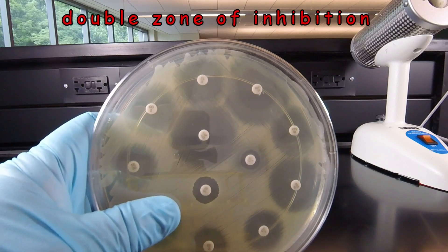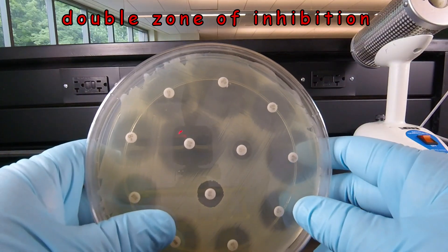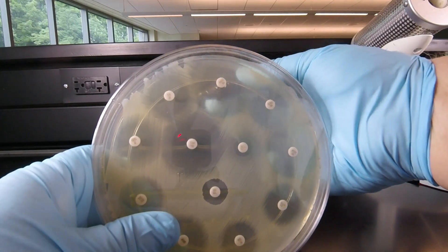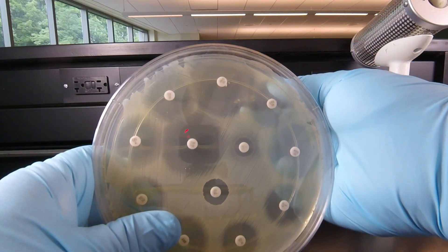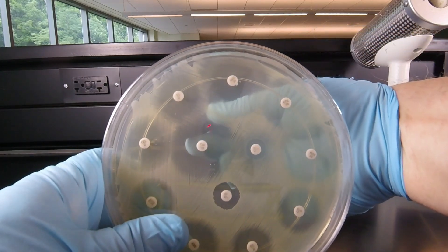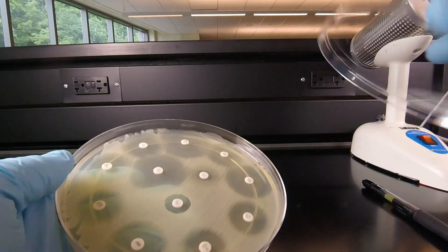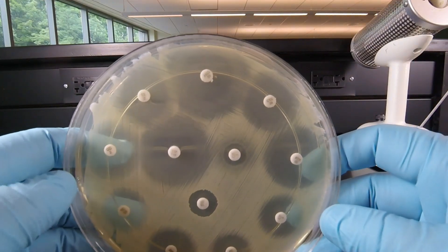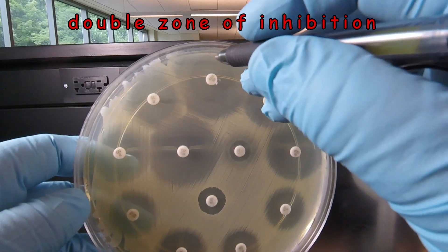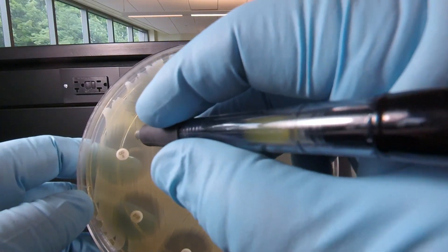Another thing you might see is a double zone of inhibition — where there's a completely clear zone surrounded by a hazy zone of partial growth. We can see that on several of these discs. I'll remove the lid so you can see the hazy zone better. You can clearly see there's a hazy zone here and then a totally clear zone right here — a hazy zone followed by a clear zone on several of these.